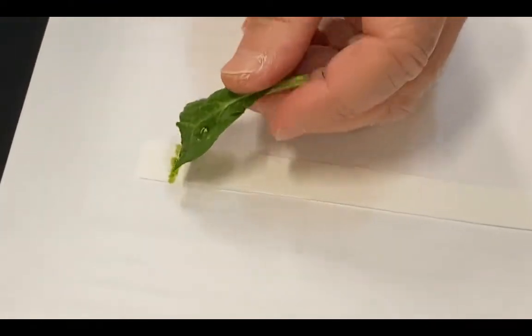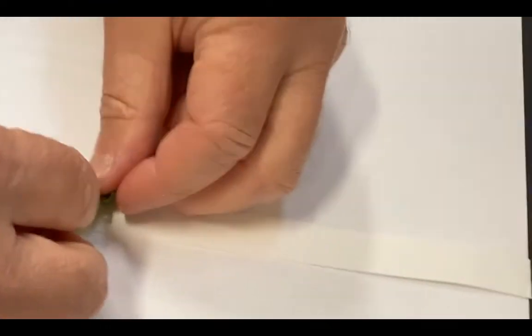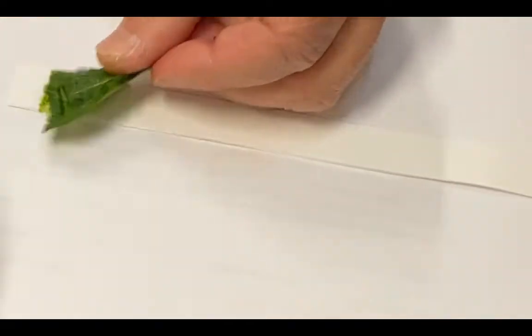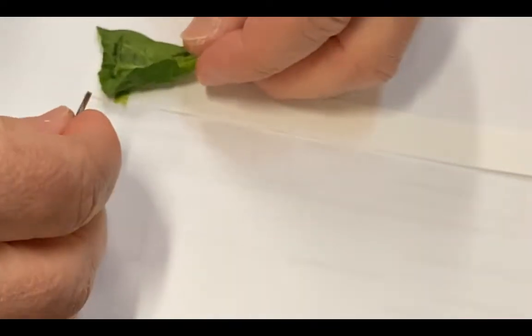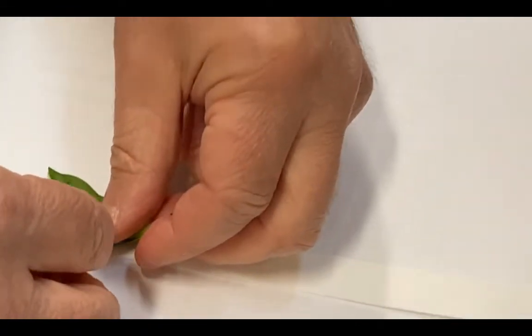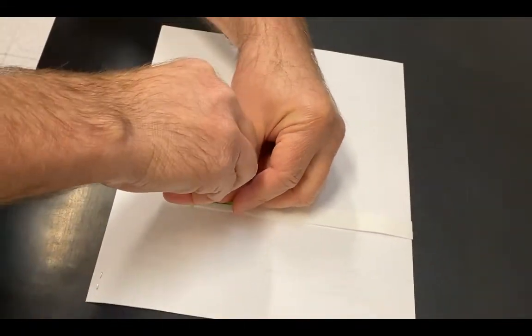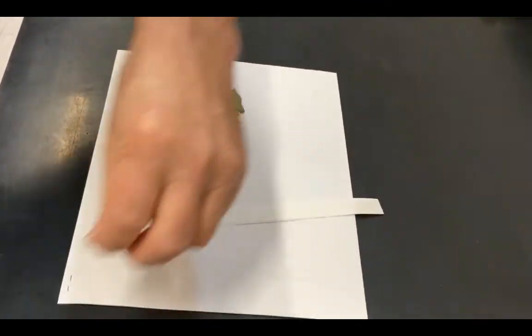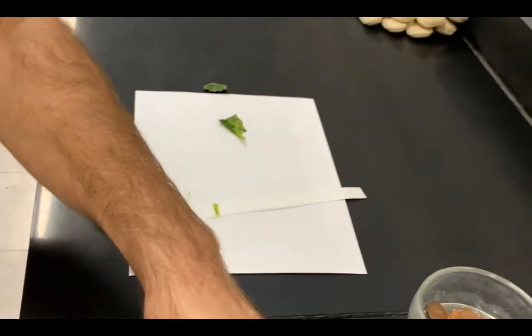So I'm going to take a look at that and hopefully I'm doing a decent job of this and I'm going to add a little bit more across that same spot. I want to make sure I have an adequate amount of pigment. Still not quite where I want to be. As I start looking at that, that's not too bad. I'm going to go with a little tiny bit more.